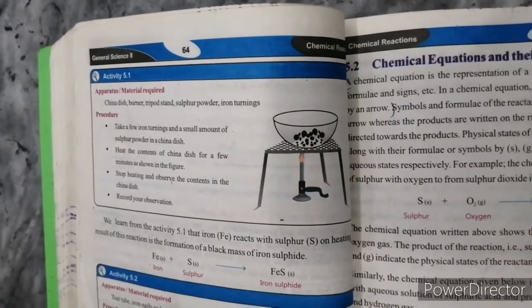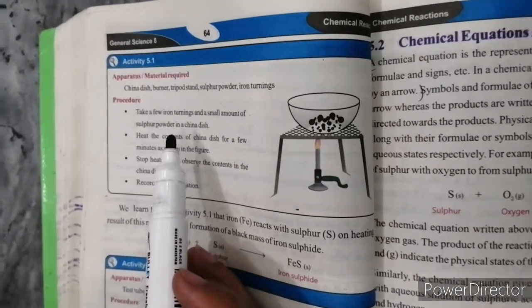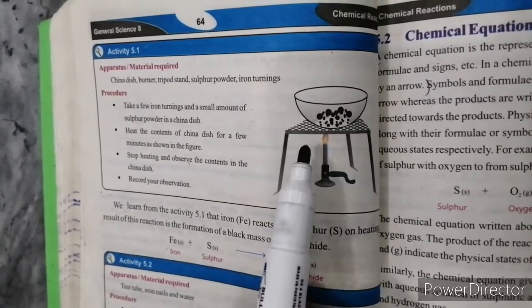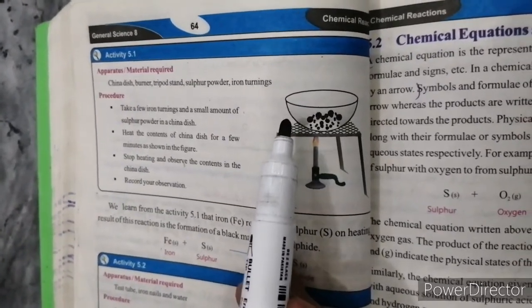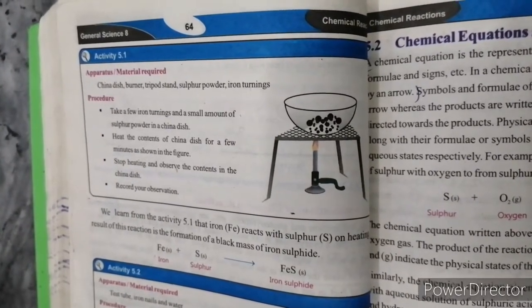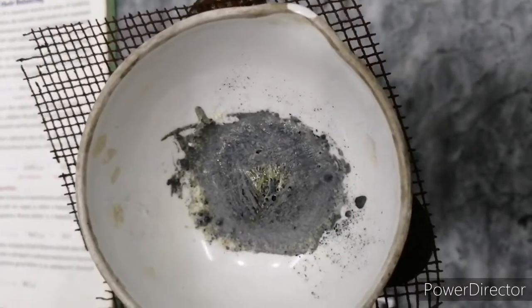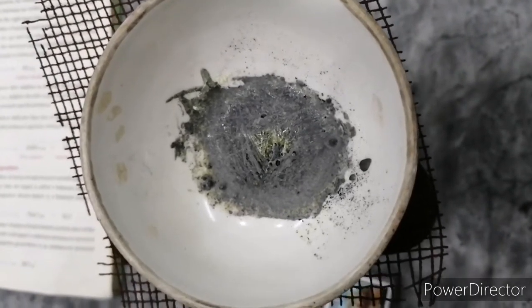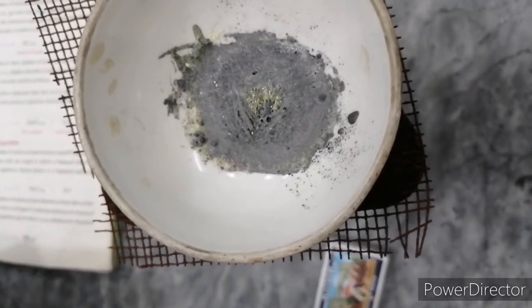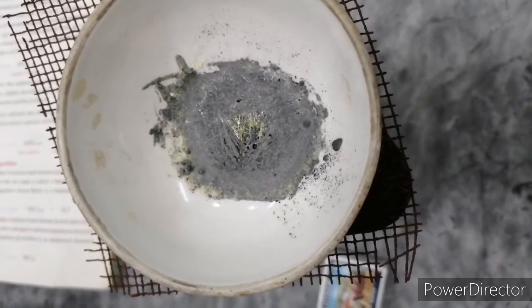Before, we have seen some examples of chemical reactions. We used chemical reactions and did some related activities. We brought sulfur and iron turnings. We had to make this black substance — iron sulfide — and you can see it here. There was sulfur and iron filings; we used these two materials. This black material is basically iron sulfide. Our activities have been performed.